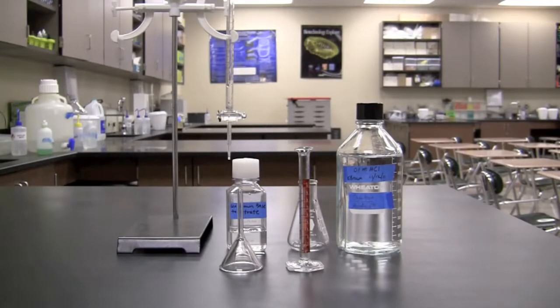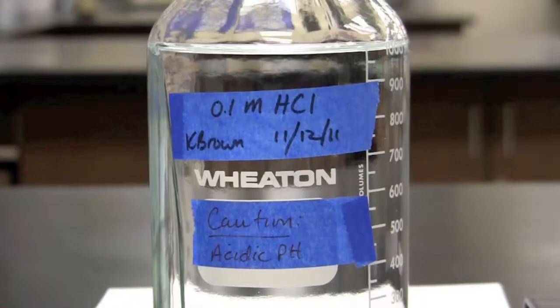In this video you will learn how to perform an acid base titration. We will be using titration to determine the concentration of an unknown base using an acid of known concentration.